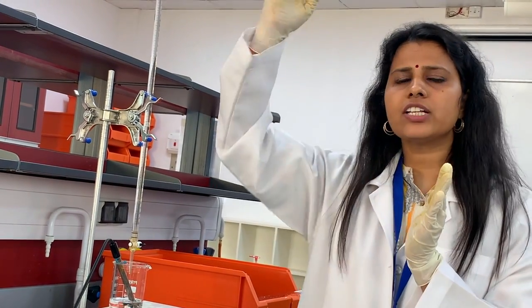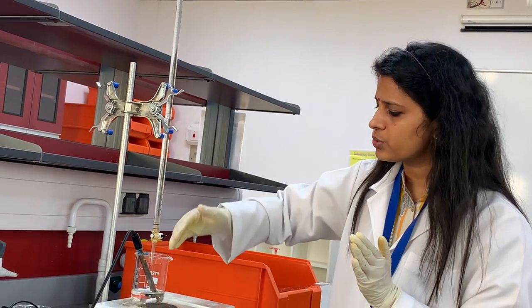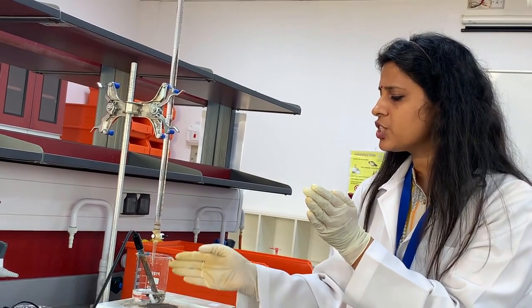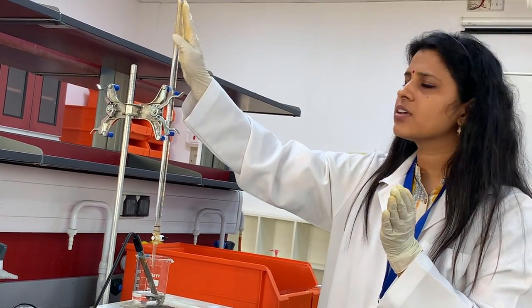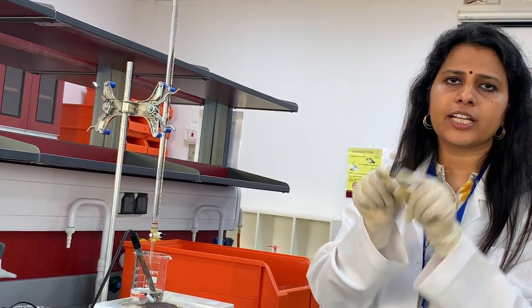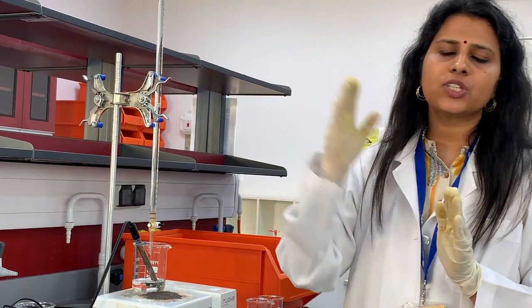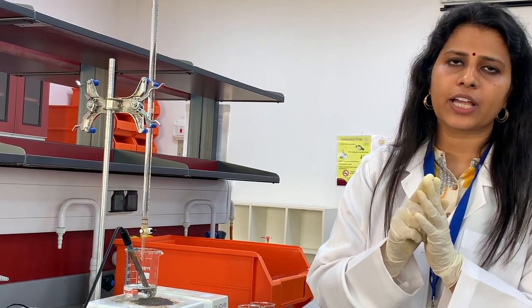Why can you observe a sudden increase in pH? When you are adding NaOH to this acid, neutralization takes place. We will reach a point where the acid present in the beaker completely reacts with the base being added from the burette. The next one drop of NaOH makes this solution alkaline, basic. So you can see the pH value suddenly increases. There is a deflection in the pH value that you can observe.